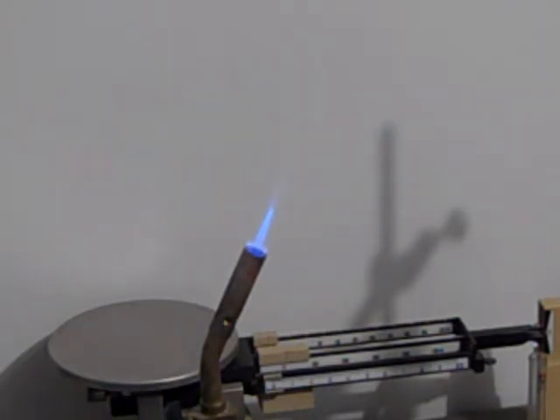I bet you that's strontium. I mixed it up with the barium. Let me just check the strontium here.